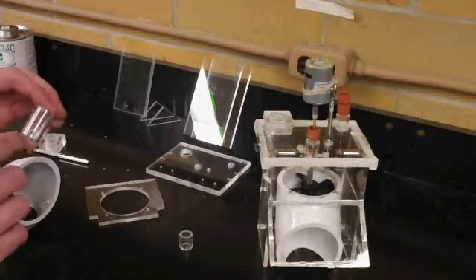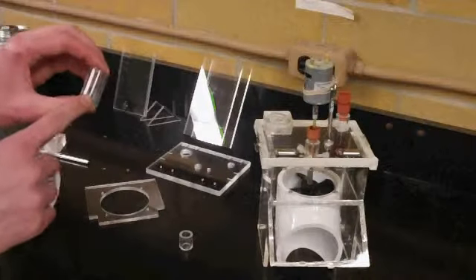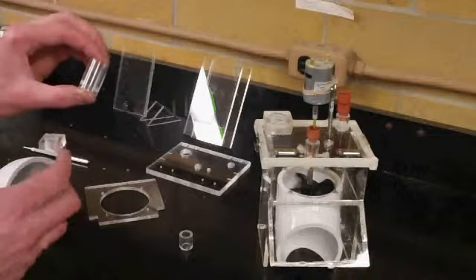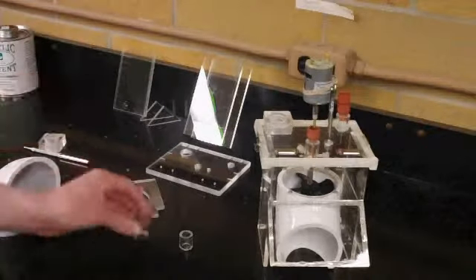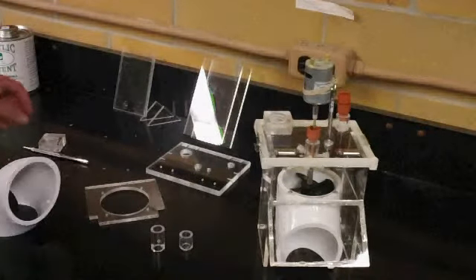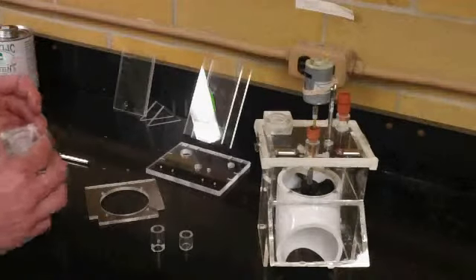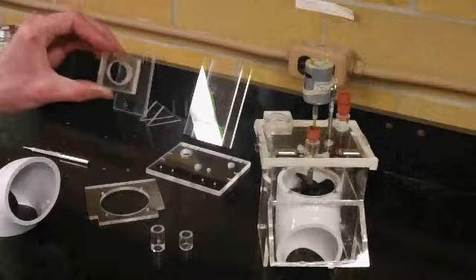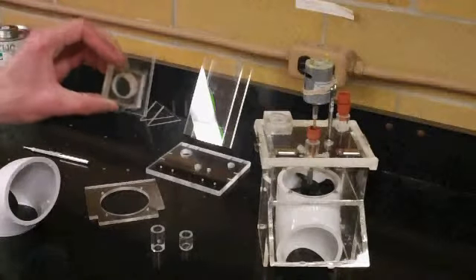Another cylinder with pre-drilled and tapped holes will allow us to adjust the motor shafting as we assemble the motor unit. And lastly, just a piece that will serve as the port for a dissolved oxygen probe.